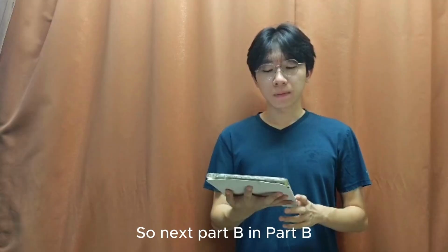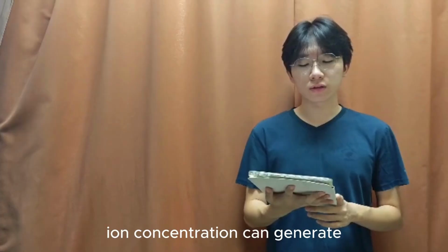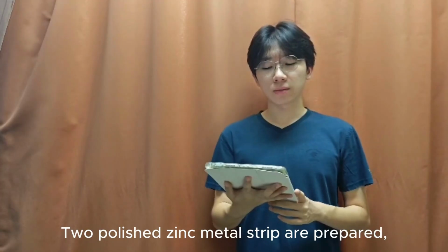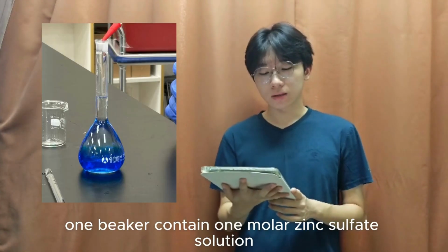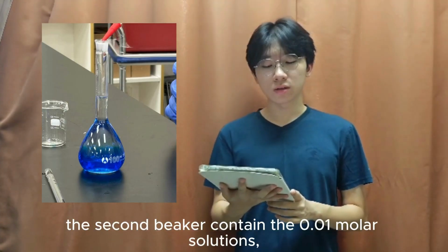So next is part B. In part B we will construct a zinc concentration cell to observe how different ion concentrations can generate an electric potential. Two polished zinc metal strips are prepared. One beaker contains 1 molar zinc sulfate solution, while the second beaker contains a 0.01 molar solution prepared by diluting the original 1 molar solution.